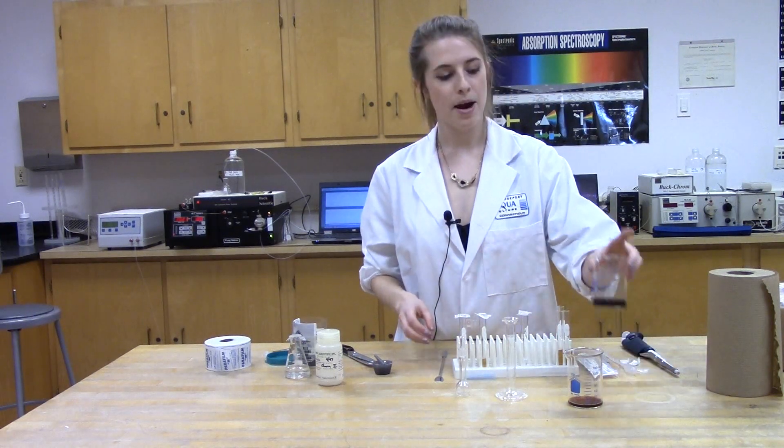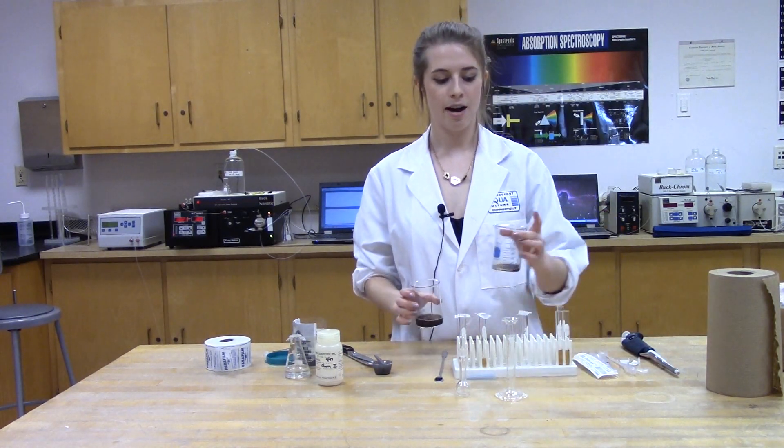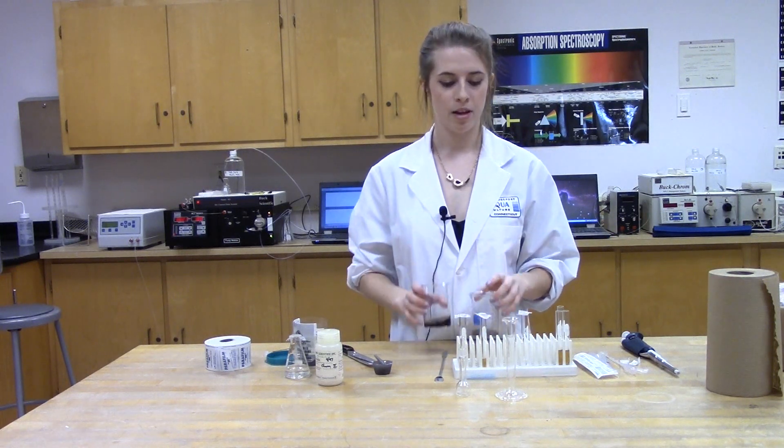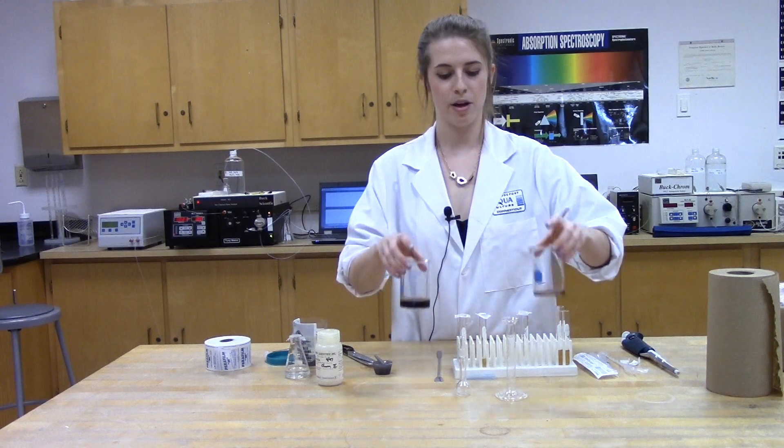Next, we're going to prepare the samples for the coffee. Here we have an old sample and a new sample. So to ensure that we will be able to compare it, we have both.